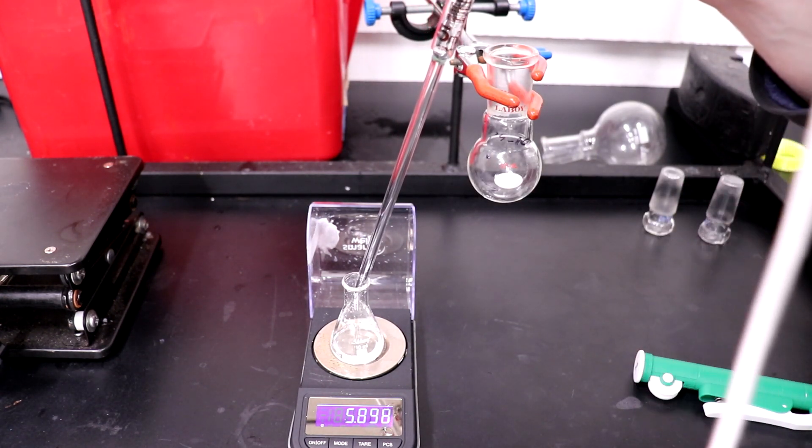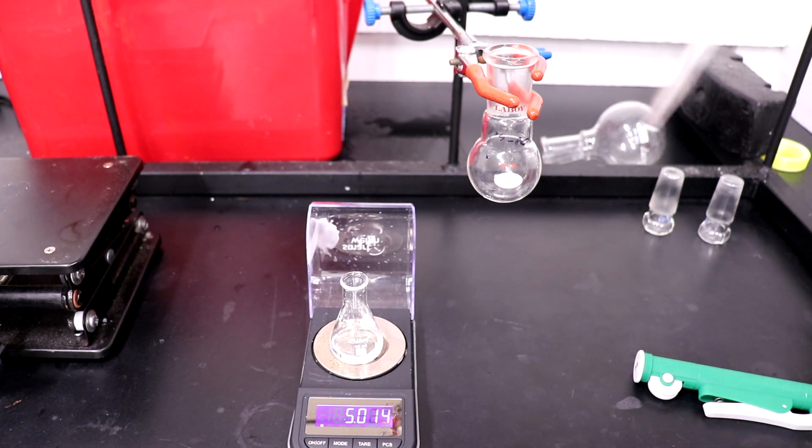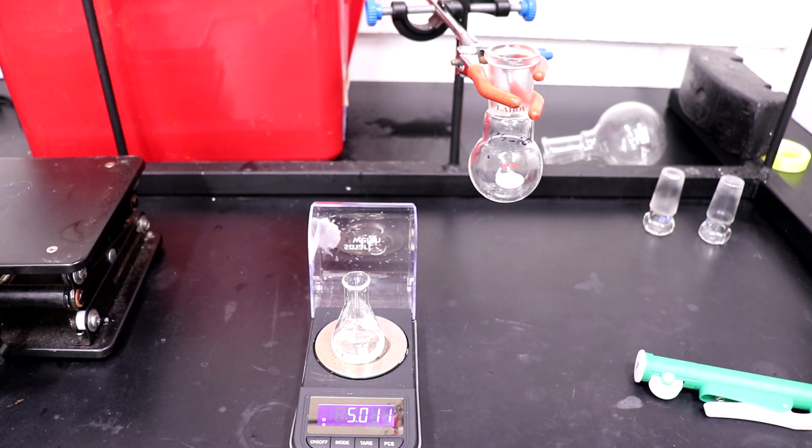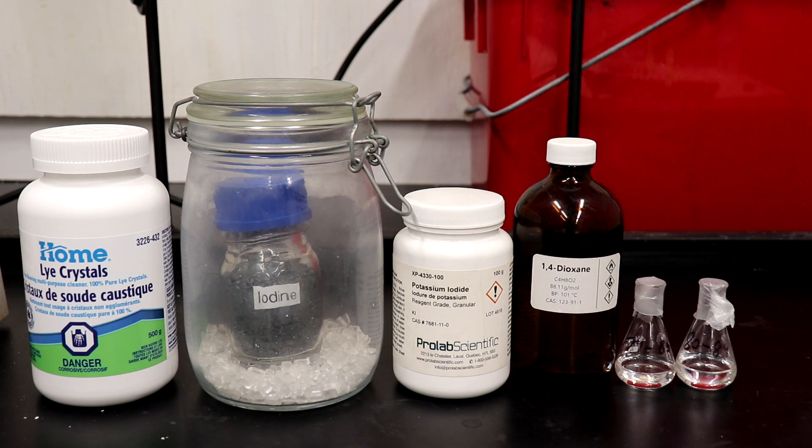While maybe not a very conclusive test, both samples also smelled identical, with no detectable note of toluene, and they seemed to match the odor description of the P-methylacetophenone very well.